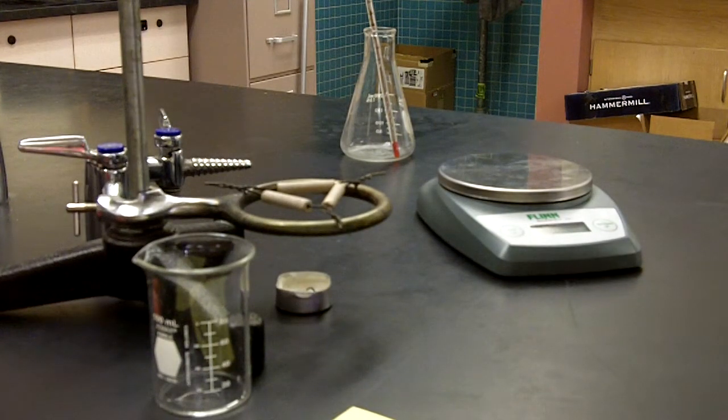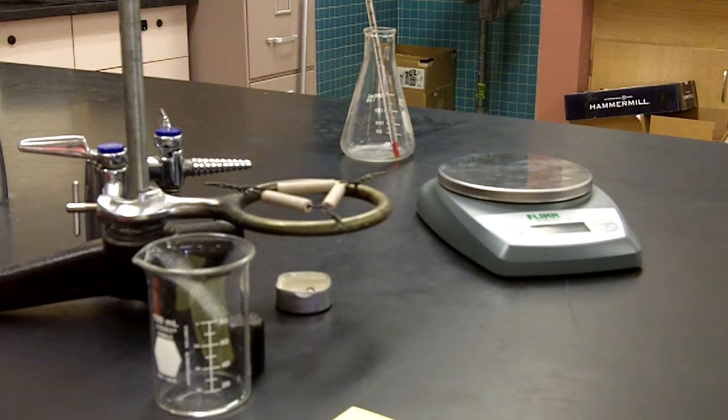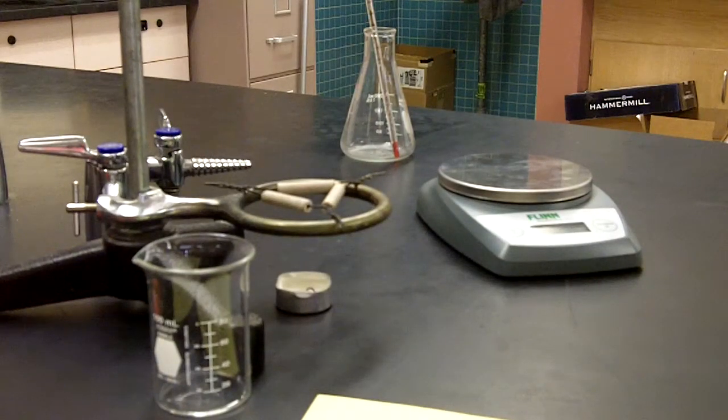Hello and welcome to the makeup video for Unit 8's lab, Thermochemistry of Candles. Purpose: during this lab you will be investigating the efficiency of using a candle to heat a known quantity of water. Thermochemistry and calorimetry are required to evaluate the heat released by the candle compared to the heat absorbed by the water in the lab. The percent error formula will then act as a comparison between the two values.